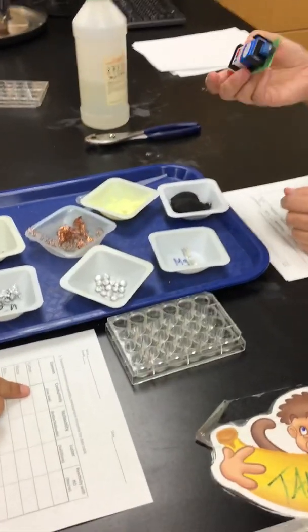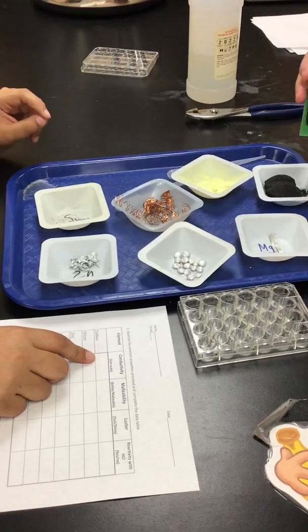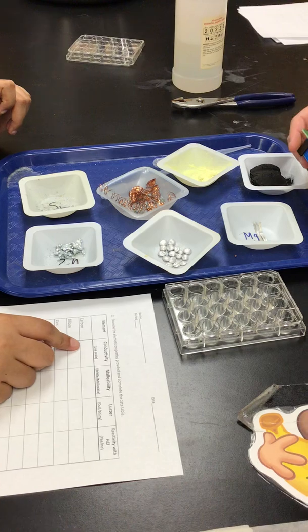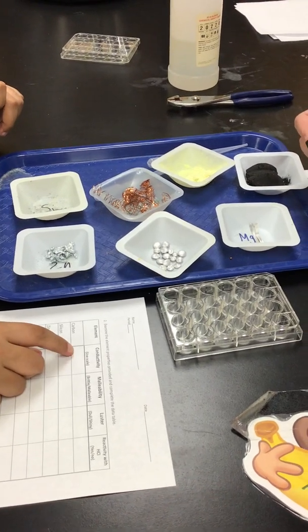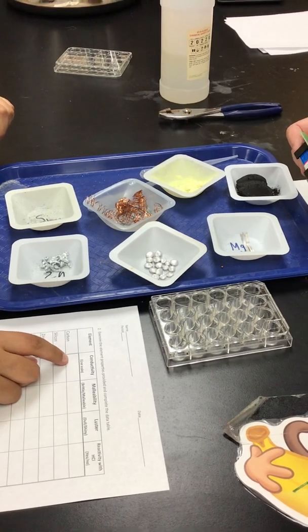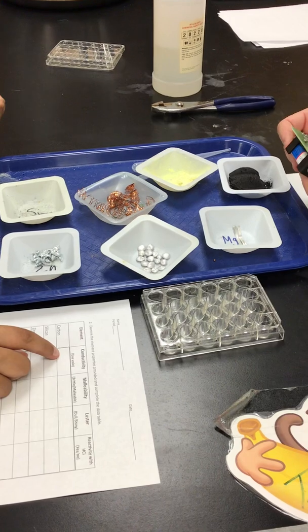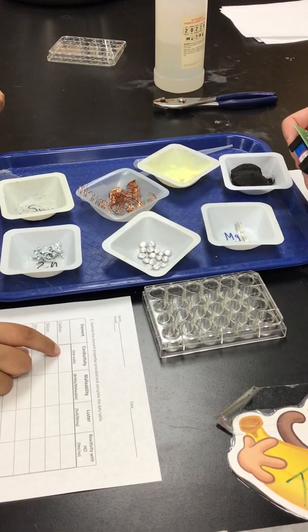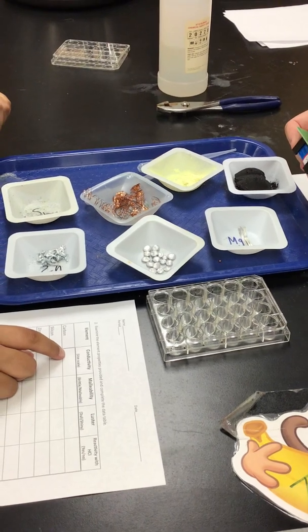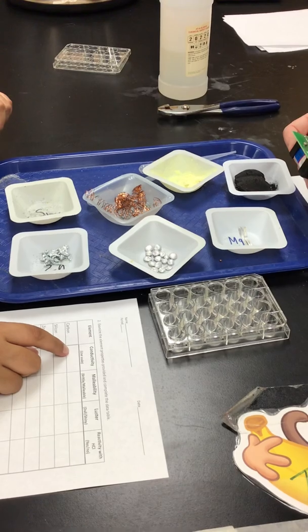How do we know if it's going to conduct electricity or not? It's going to turn green. The green light will turn on. And on the back, it says that if there are no lights on, there's no electricity. If the red light's dim and the green light's off, it's low. Medium, if the red light's medium and the green light's off. High is when we have a bright red light and a dim green light, and very high is when we have both of them on.